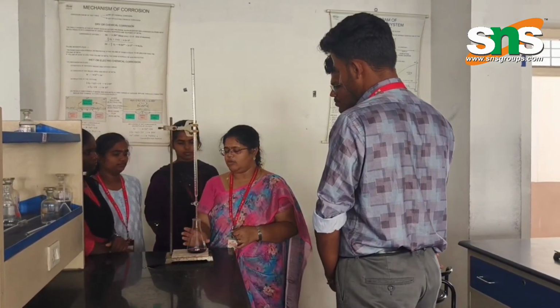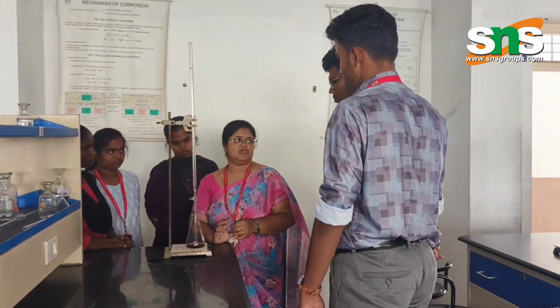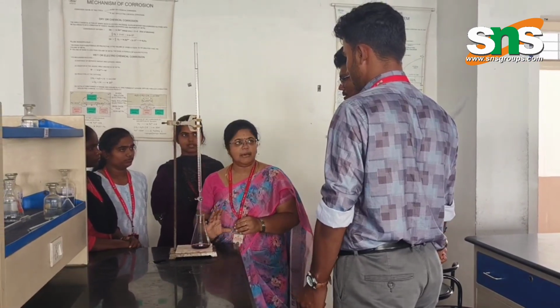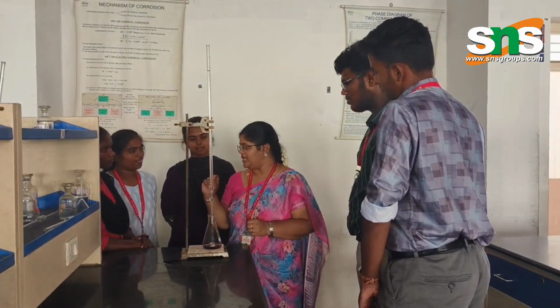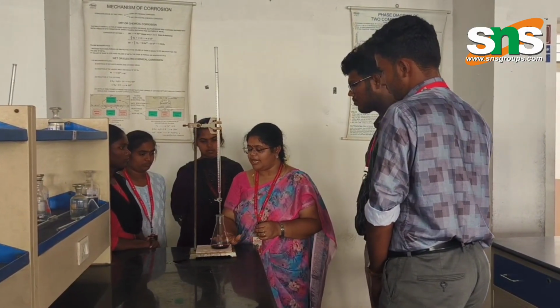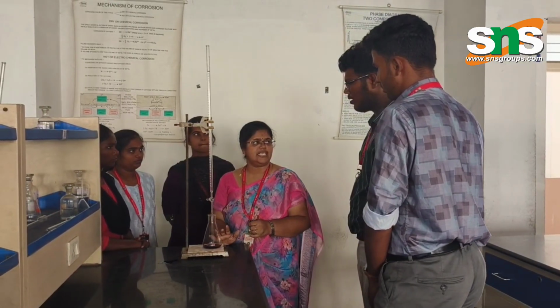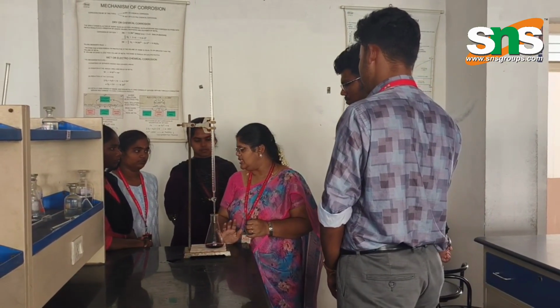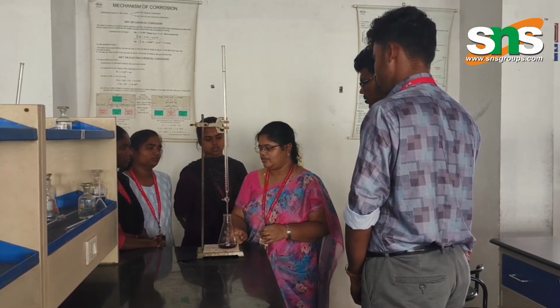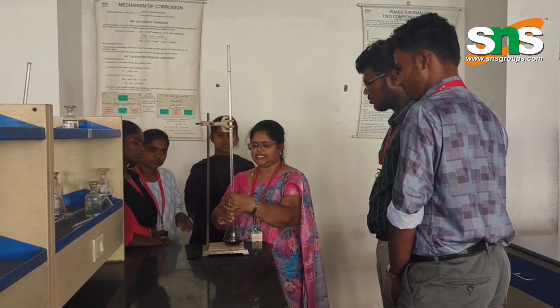Now I have taken 20 ml of the standard hard water and added 5 ml of buffer solution. Why am I adding buffer solution? To maintain the pH. Only at a pH of 8 to 10 will the reaction take place, so I am adding the buffer solution. What indicator is added here? The indicator used is EBT, that is Eriochrome Black T indicator. So I am getting a wine red color. Now I am going to titrate it with the EDTA solution.